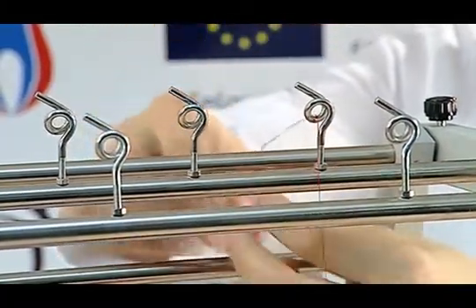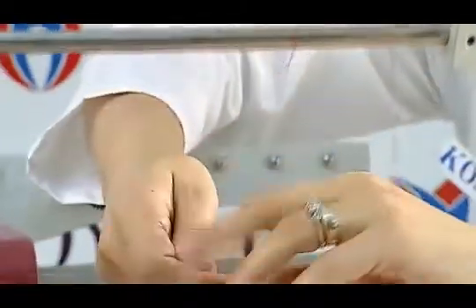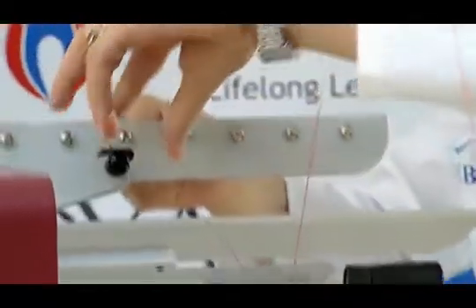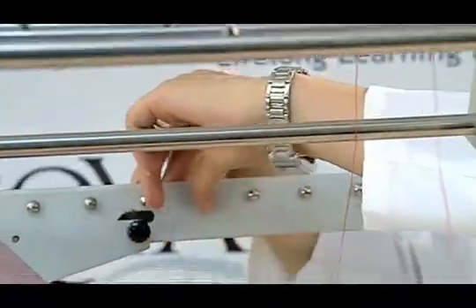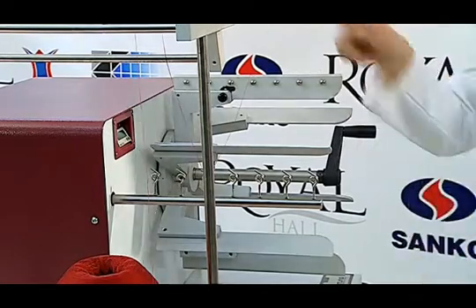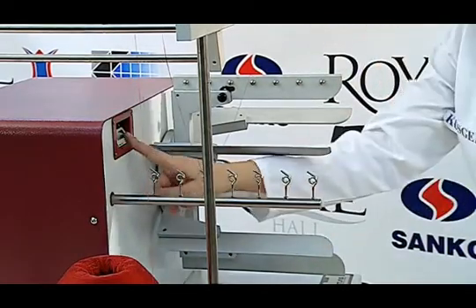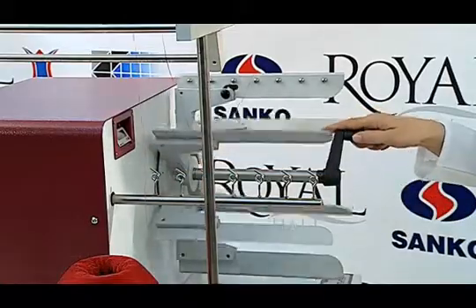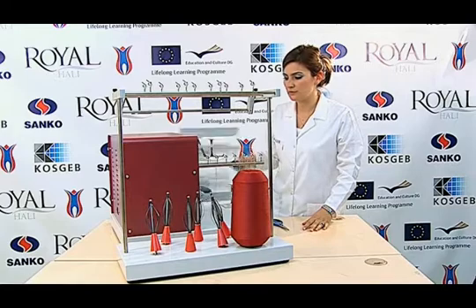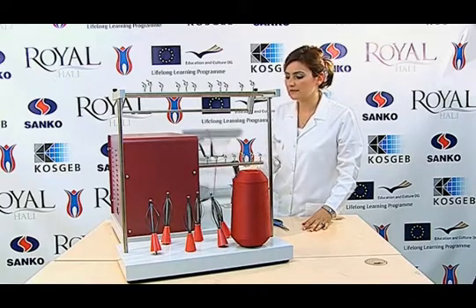Then we get a constant tension over the yarn on the creel. A cycle of the reel is one meter long. We reset our screen. We turn the handle at a fixed speed. Five samples can be tested simultaneously.